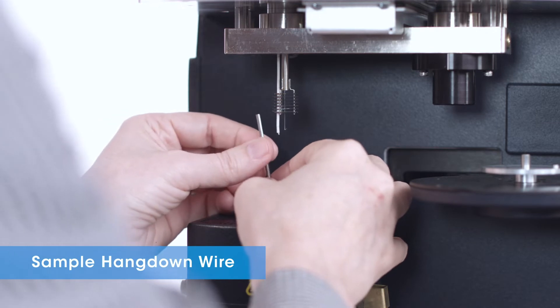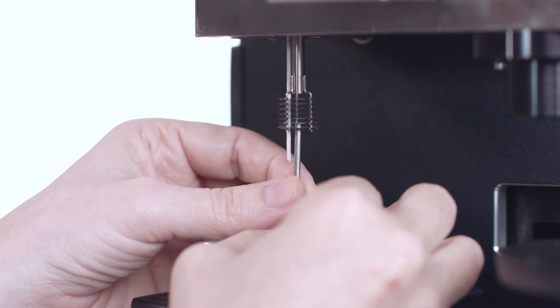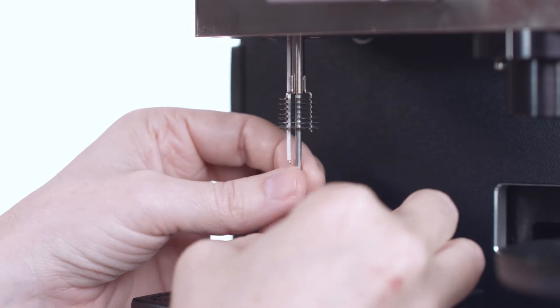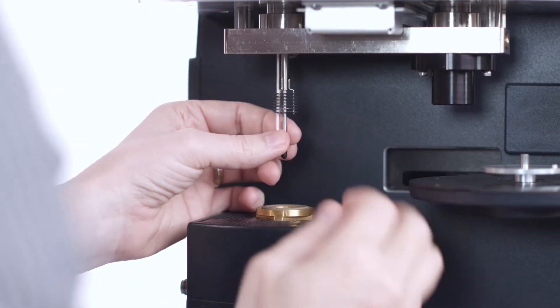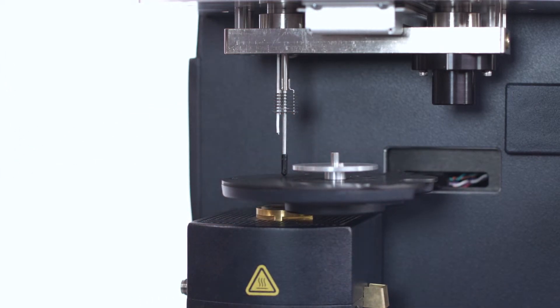Insert the tool partially into the furnace and then carefully raise it up around the hang down wire and insert it through the hole previously noted. Raise it high enough so that the auto sampler can be manually rotated underneath the tool and the tool can be allowed to rest on the tray.